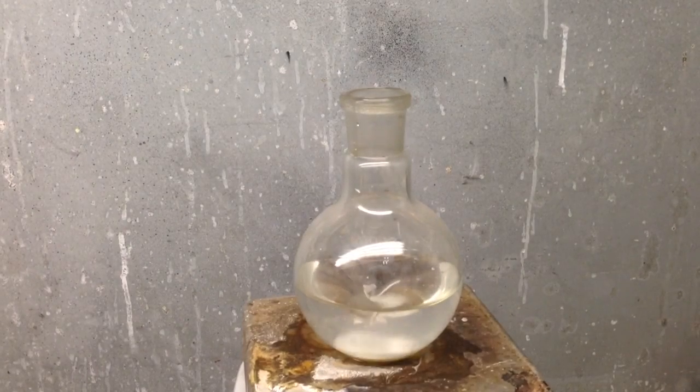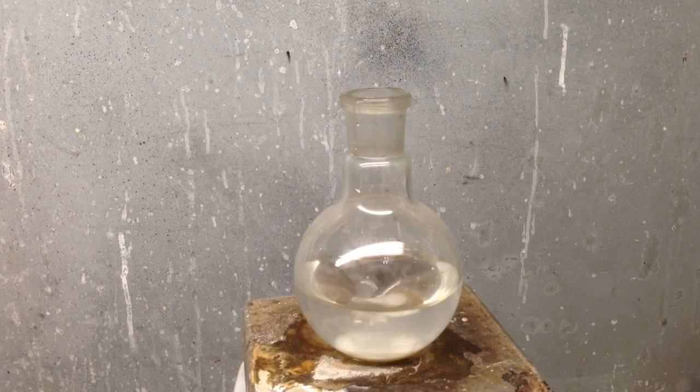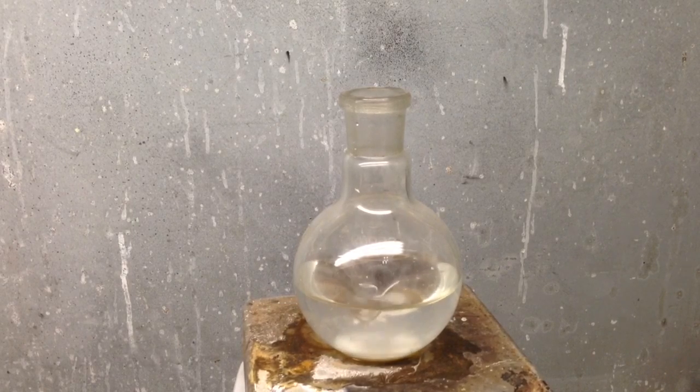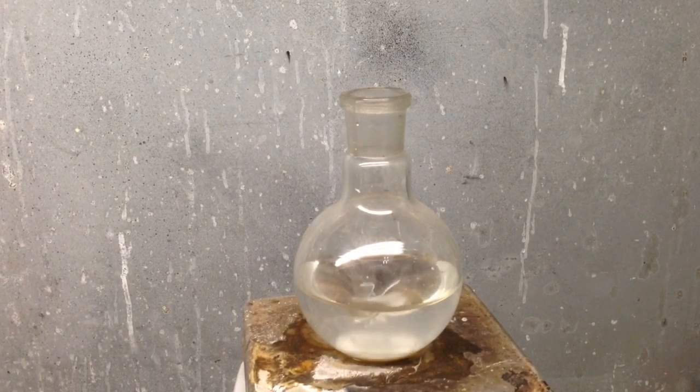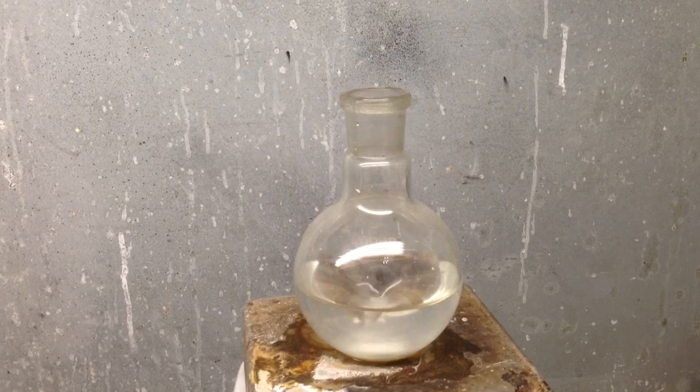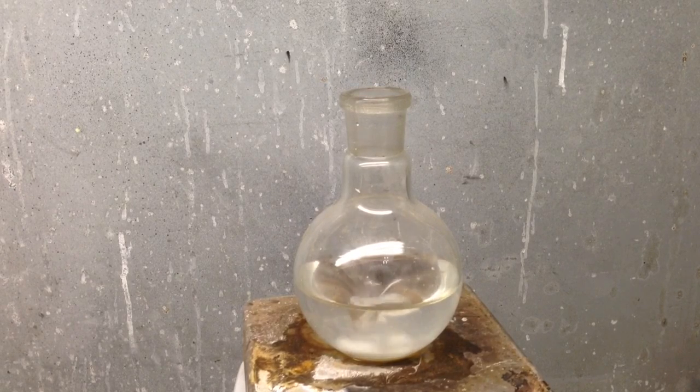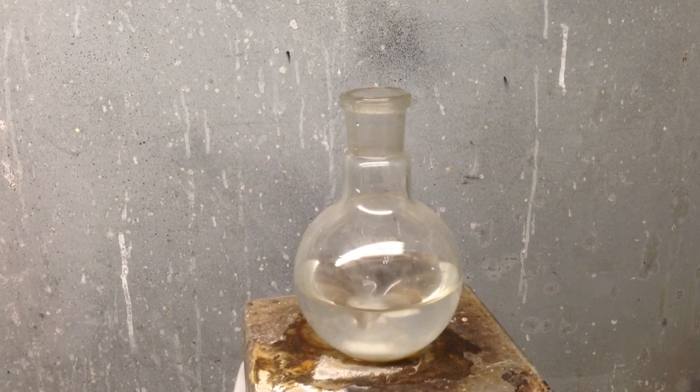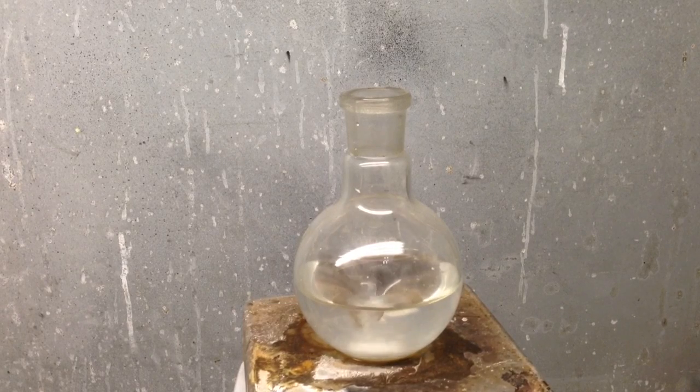So to start with, you want to dissolve your sodium hydroxide in your water. Most people say when you're dissolving sodium hydroxide in water, you do it slowly. Obviously, you don't want it to boil over and splash on you. It's very caustic. It'll burn your skin and things like that. So you want to be careful.